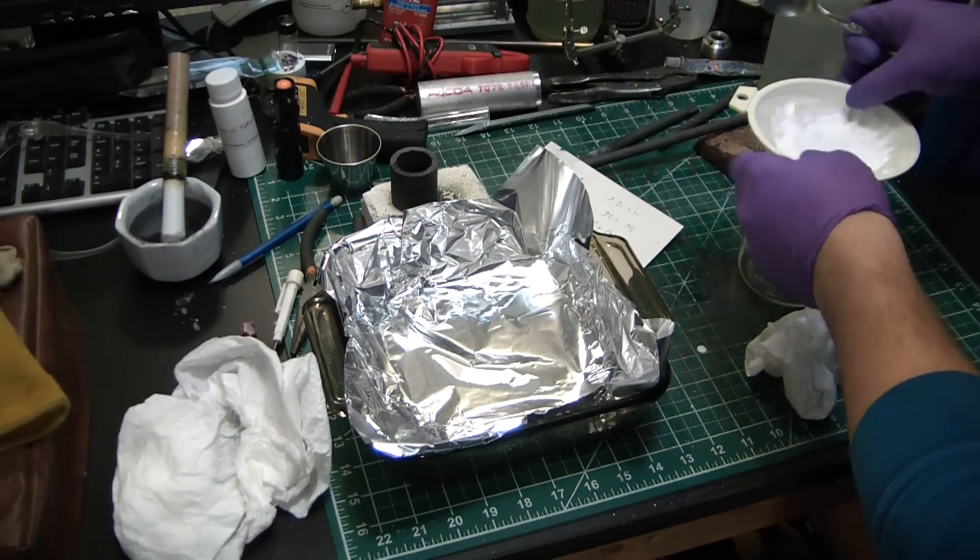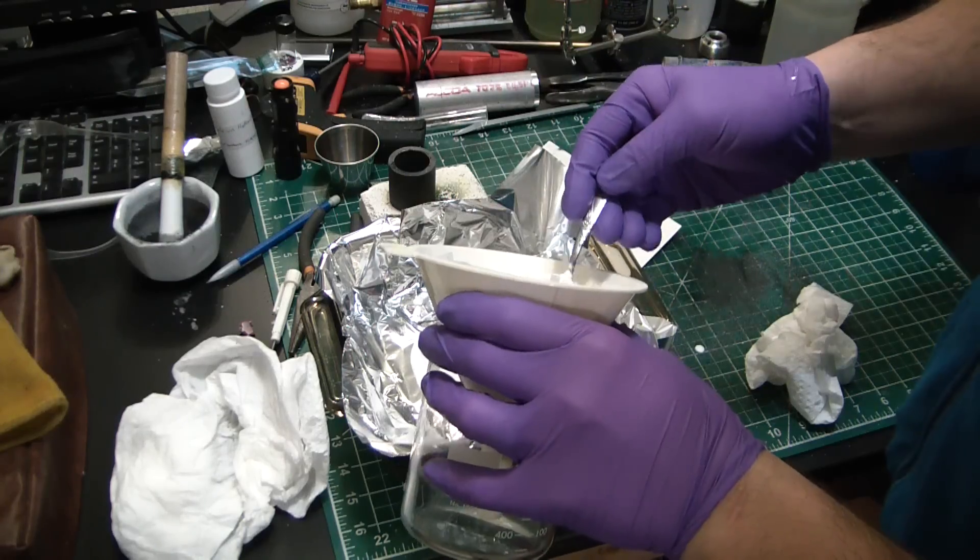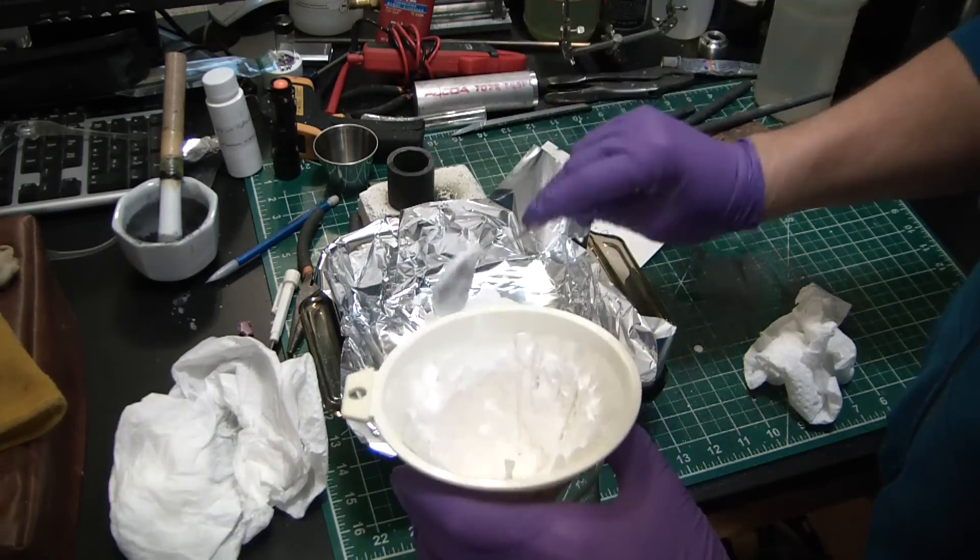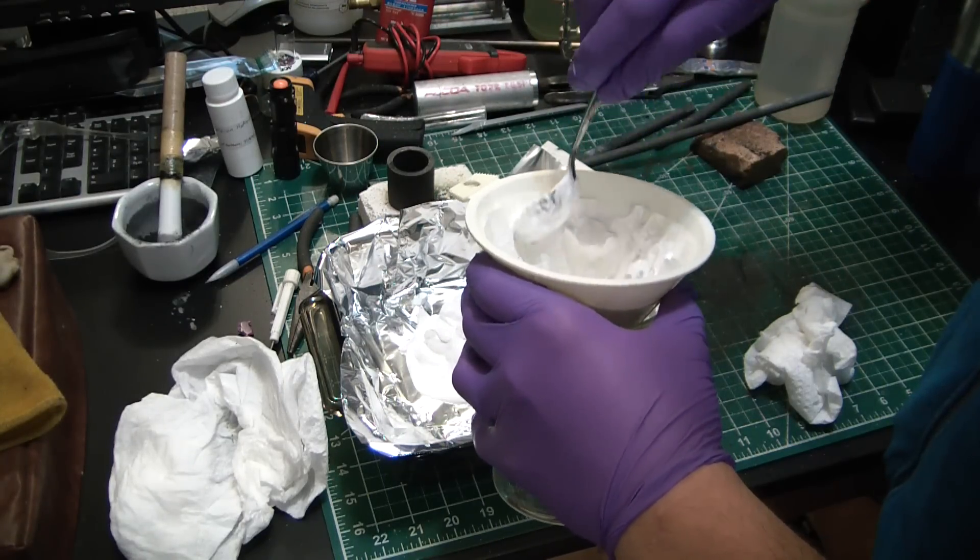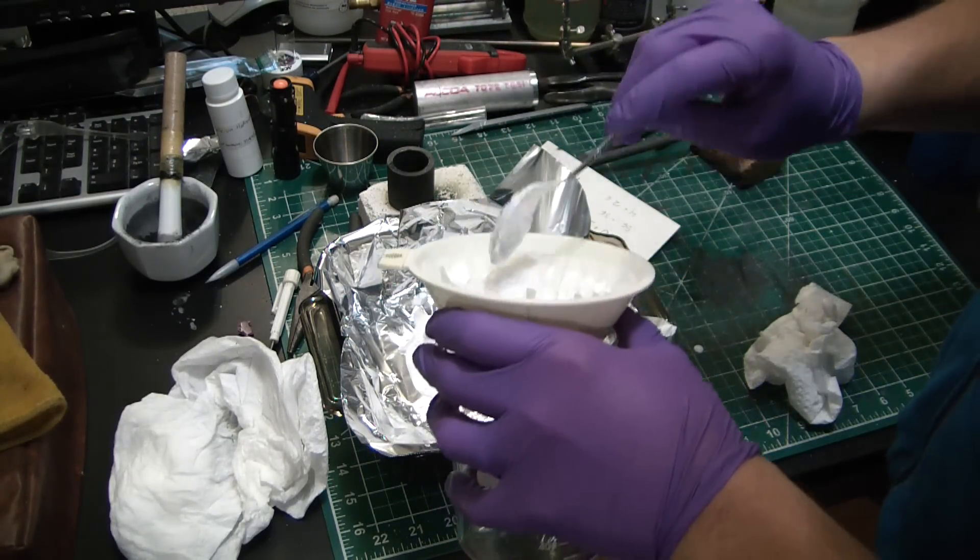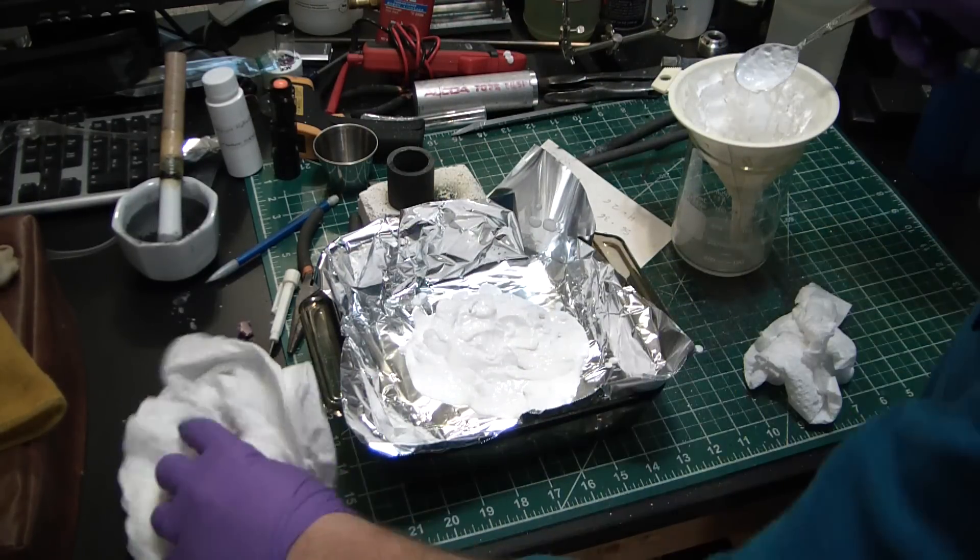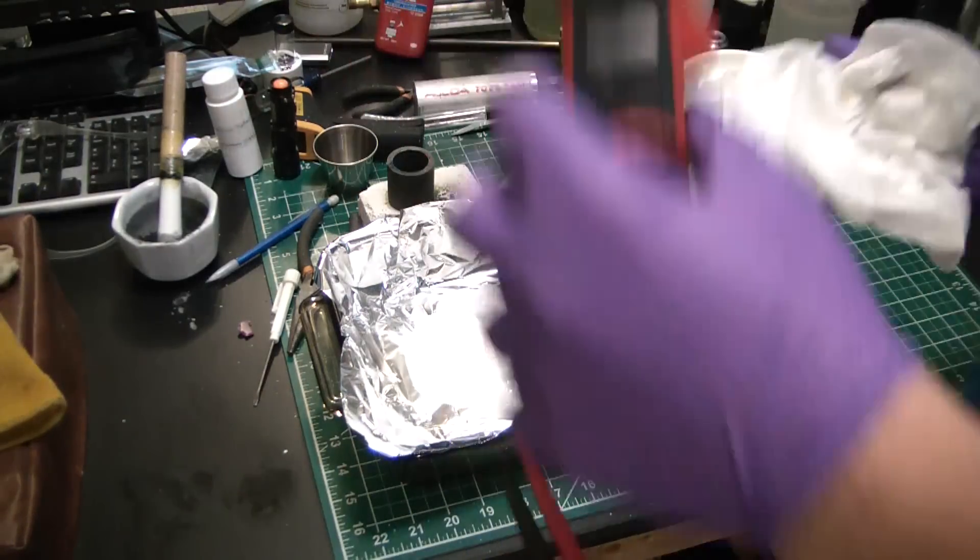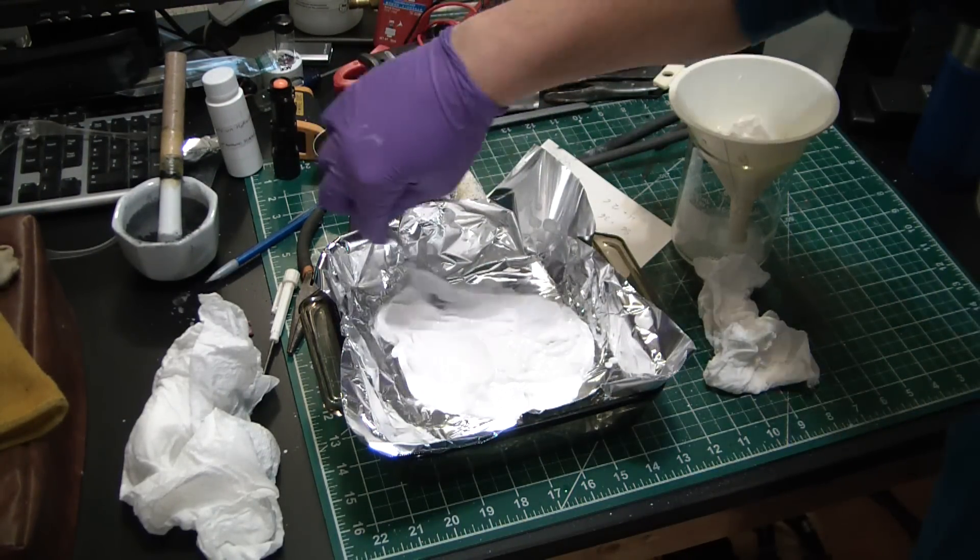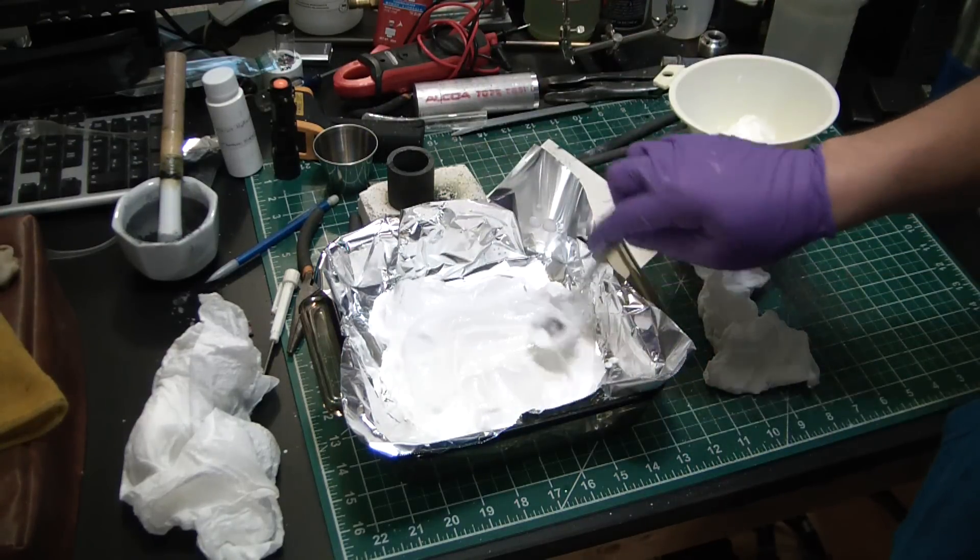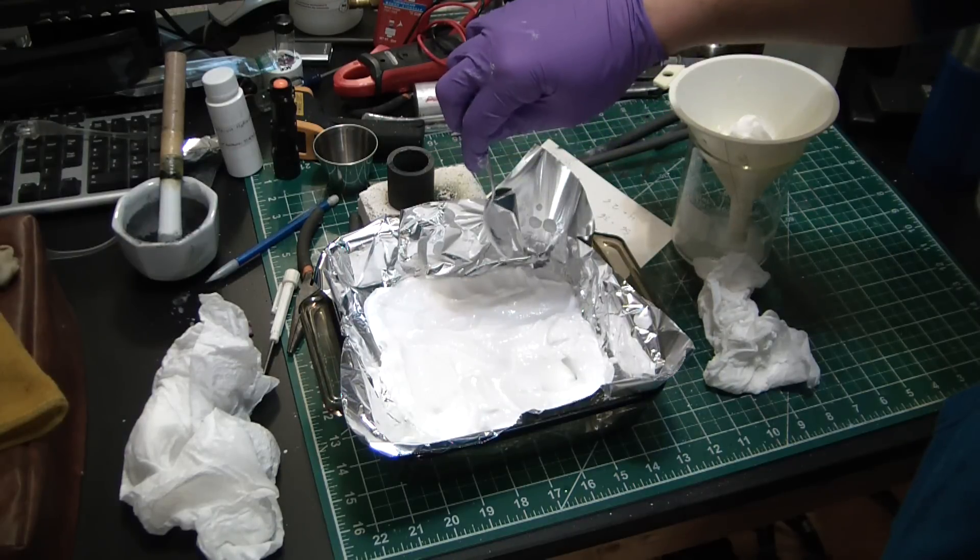All right, just going to go about scooping this all in. Good news is I think we will have plenty to run the experiment I have in mind. Should be a good bit of fun. Got hydroxide on my meter, can't have none of that. All right, just going to spread it out so it dries relatively evenly. Hopefully it won't react with the aluminum foil. I don't think it really should.